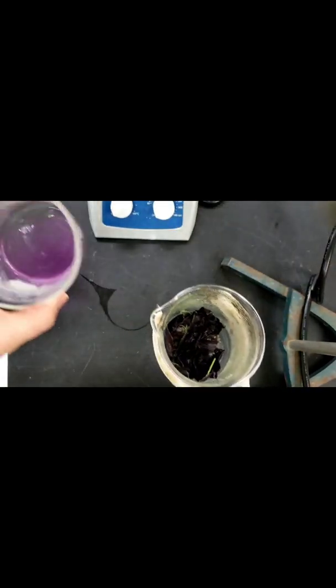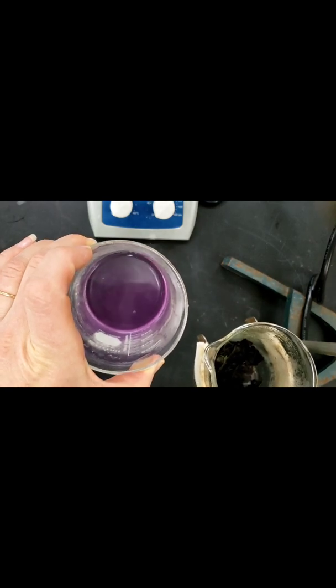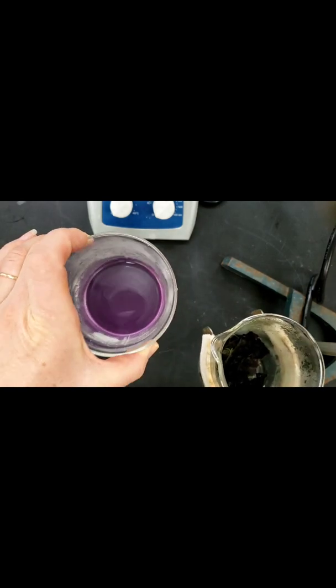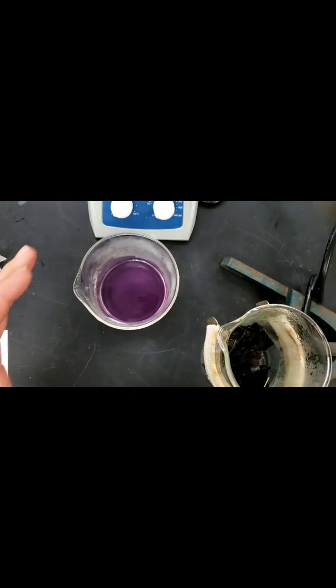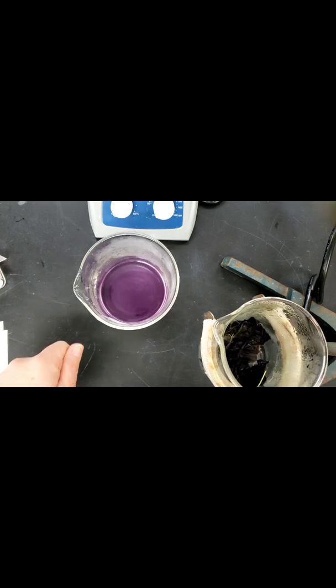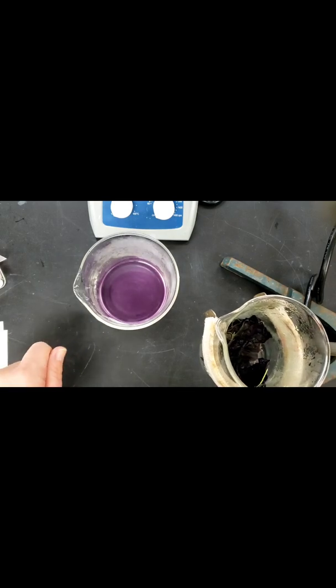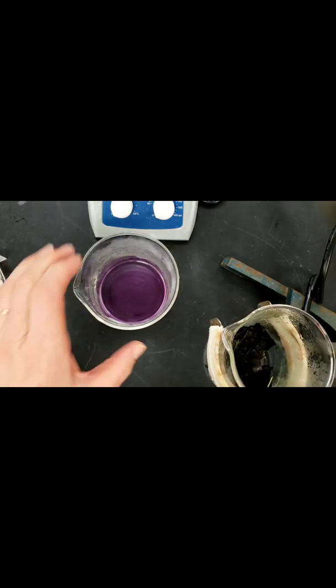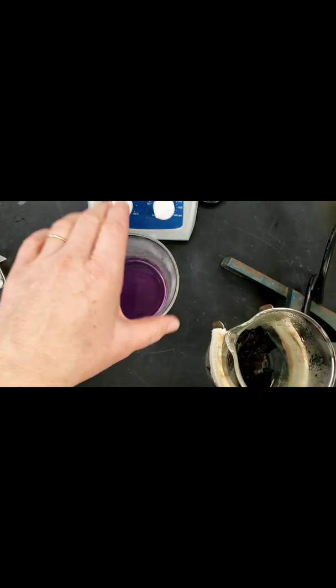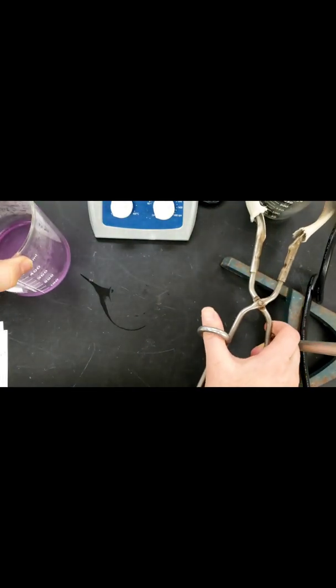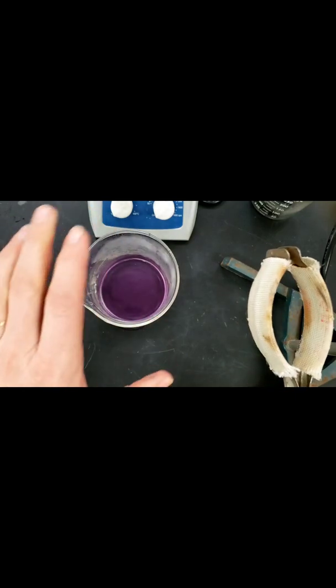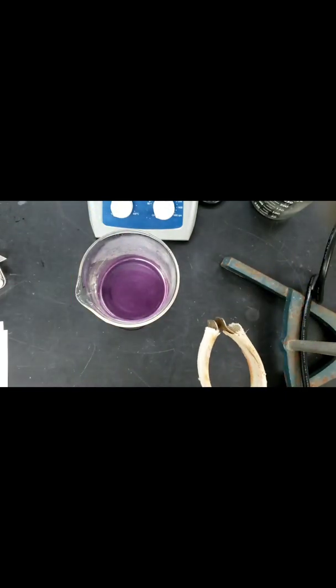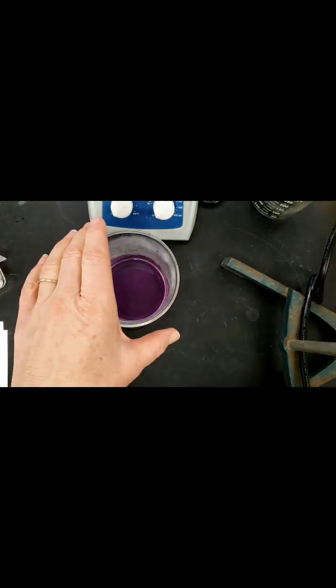You do also at this point want to take a selfie of cabbage juice or use a note card and take a picture so you can include it in the PowerPoint slides. We're going to allow these to cool. Make sure you use a potholder or something to handle the hot containers. And while that is cooling, we're going to make a measurement with our pH paper.